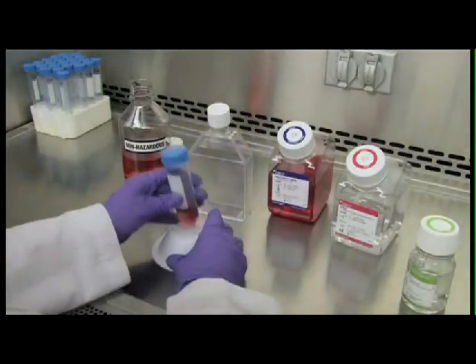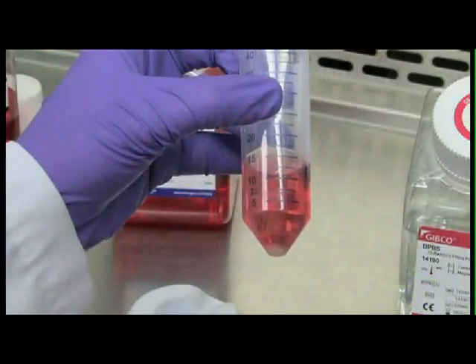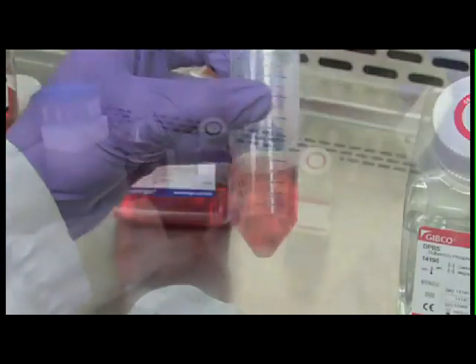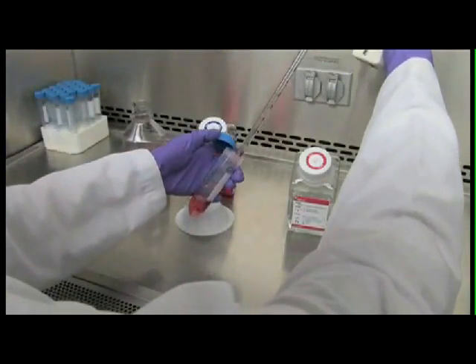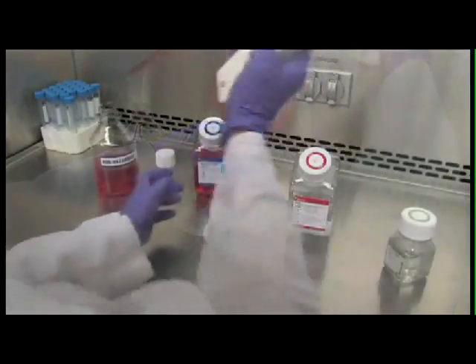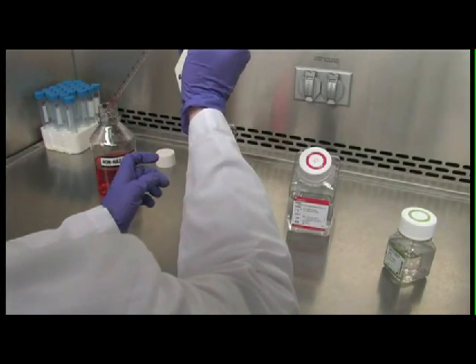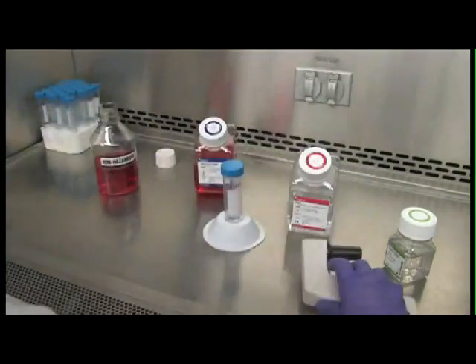After centrifugation, you should have a well-formed pellet. Remove the medium from the centrifuge tube with a pipette and discard the medium into a waste container. Try not to disturb the pellet.